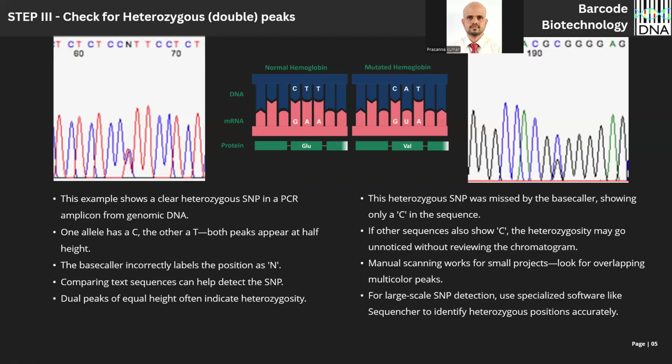This is not a mistake. This is not the inability of the software to call a particular nucleotide. This is genuine data, meaning both the fragments were present. Both the fragments of cytosine and thymine were present in the amplicon, single strand amplicon. So this is a classical case of single nucleotide polymorphism.